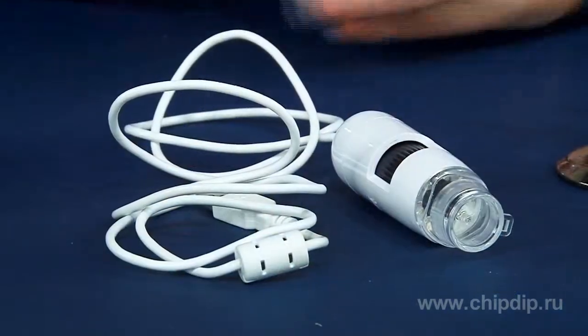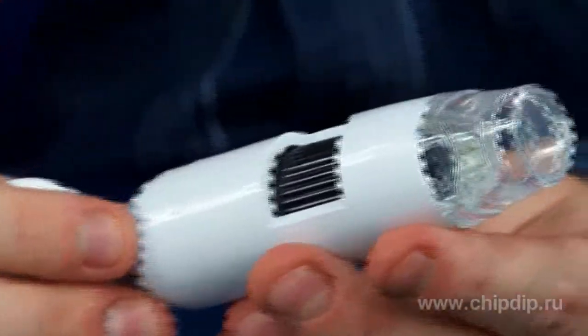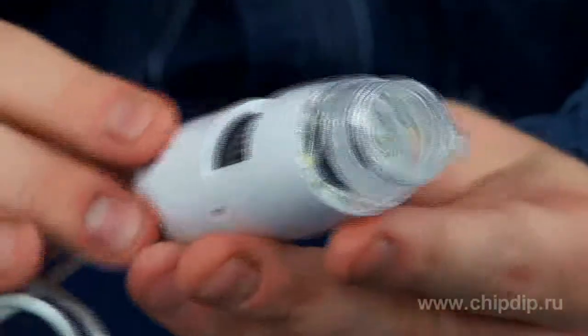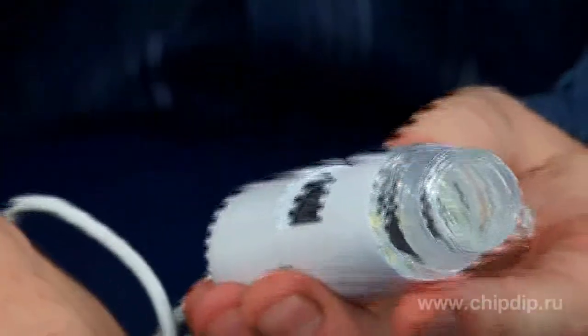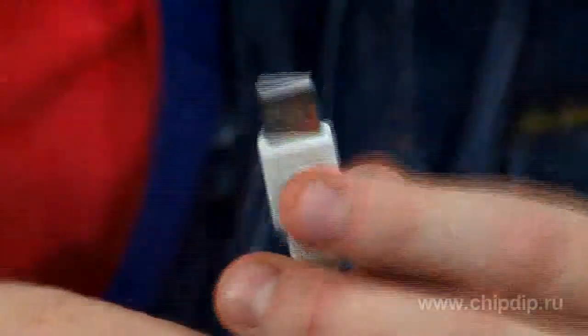A portable USB digital microscope is a fully functional device which can be connected to a PC and allows viewing small objects on the display.